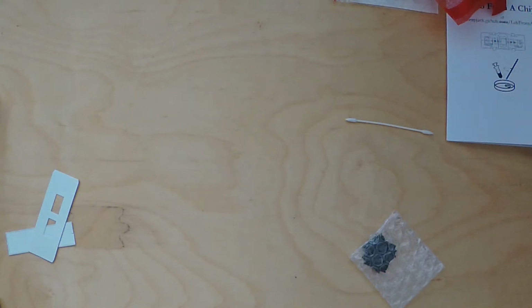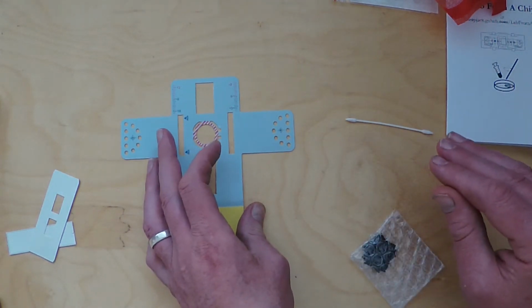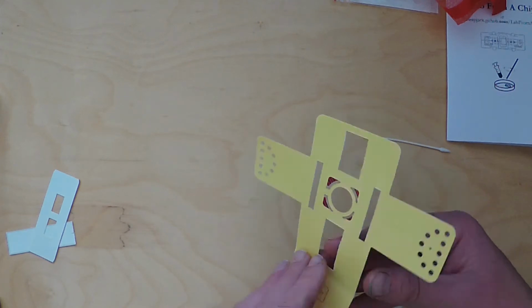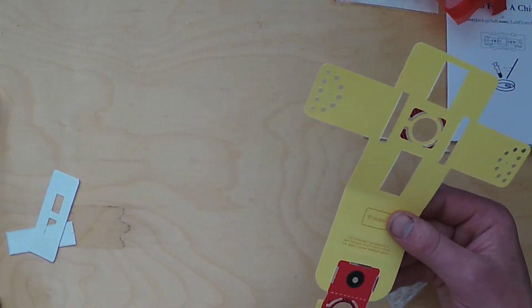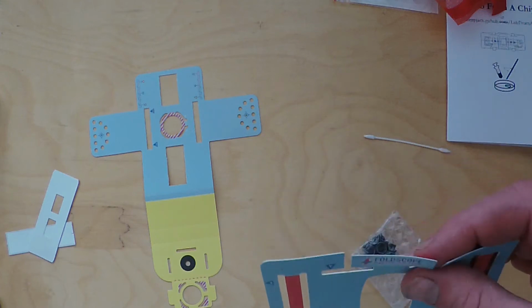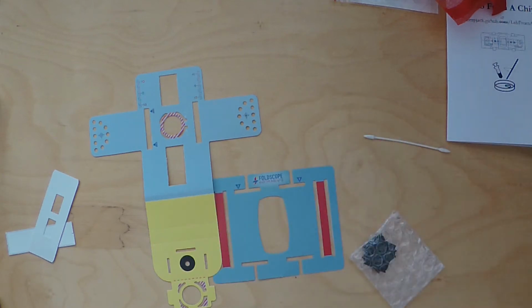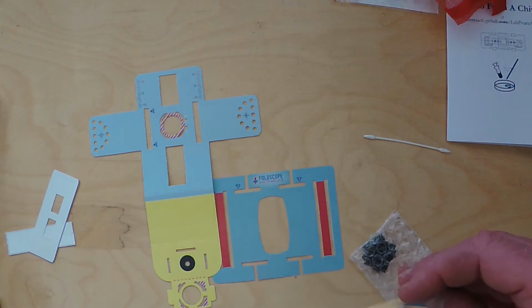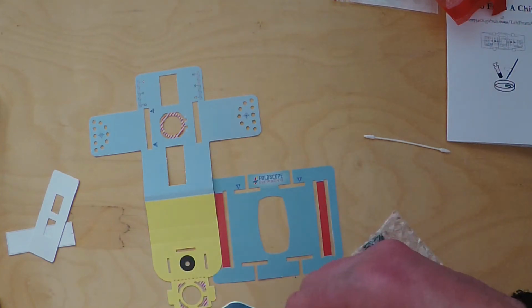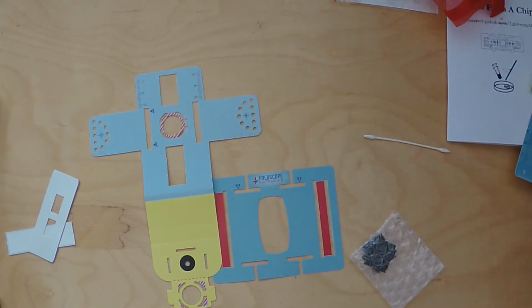You'll end up with your lens stage here, and when you're looking at your instructions, which do follow the instructions as well as following this video, there's two sides to it, and you'll see the different patterns and coloration matters when you're assembling the lens couplers together. Okay, you'll end up with that. This is our thing to help us move the sample around from left to right and up and down, and then you'll end up with the actual sample stage, which holds our slide together through these two slots in there. So let's just go through each of these components following their instructions.